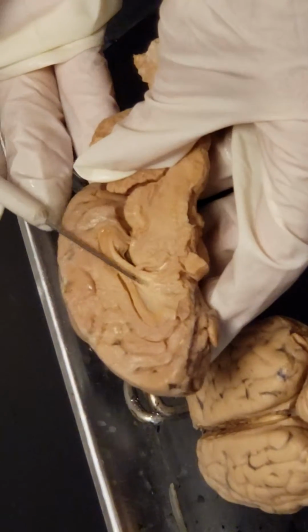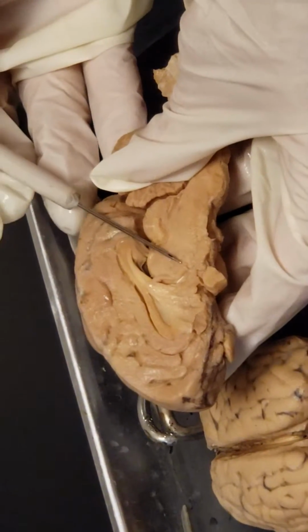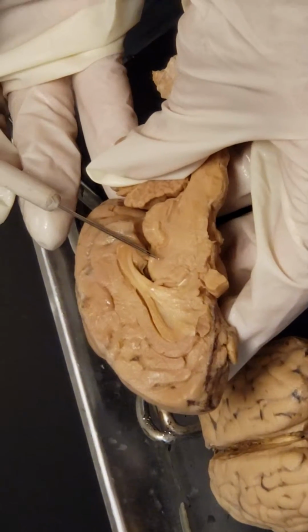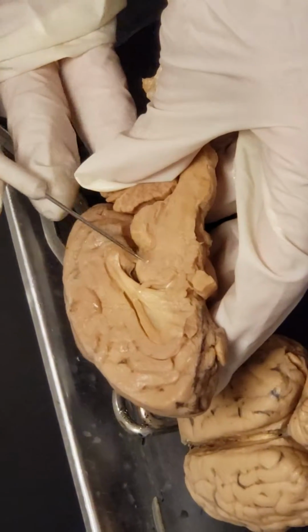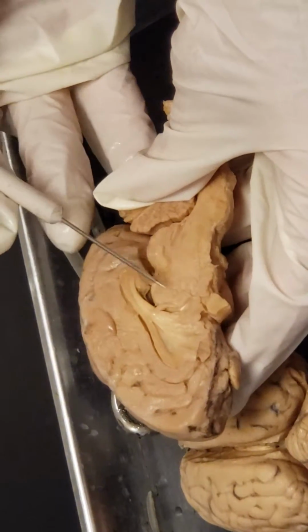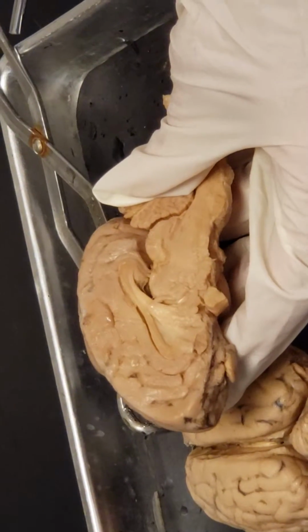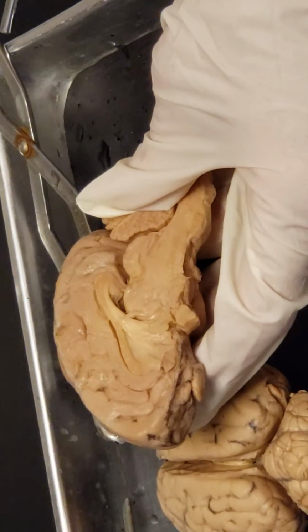So this is the fornix underneath. And then if we continue to move down, we hit the thalamus. So the thalamus is sort of a circular mass here. And I lost my place. Oh, and the intermediate mass of the thalamus. So this is the thalamus. The intermediate mass, again, is the bridge that relays information between the 2 sides of the thalamus. I don't see it really well here, but it will be in the middle of the thalamus. It actually runs through the middle of the 3rd ventricle to relay that information in between.